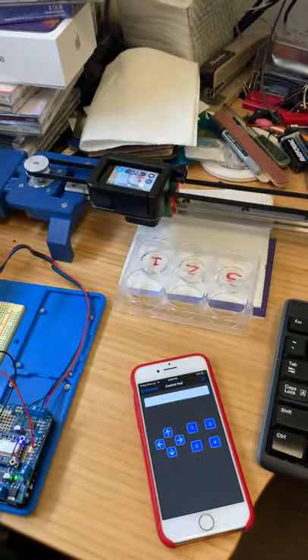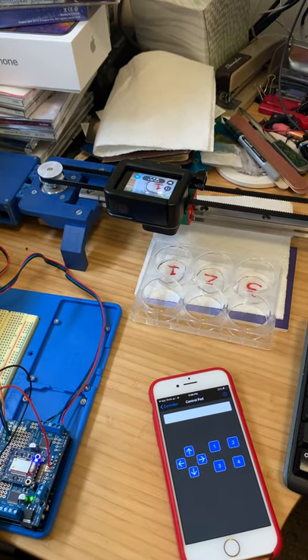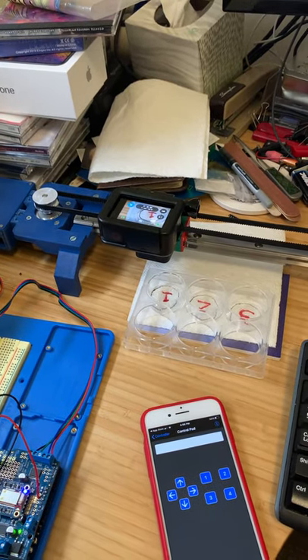So that's the whole demo, and that's the X direction, which seems to be working pretty well. And it looks like I can fit about three of these well plates, that would be 9 cells across in one row that it can operate on.